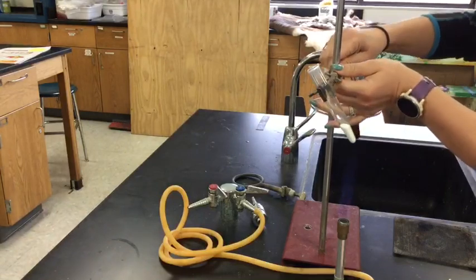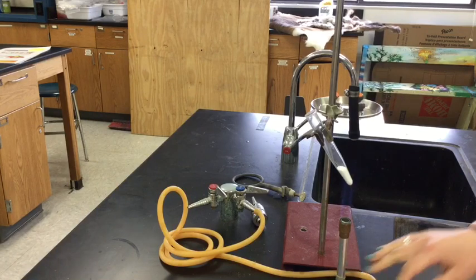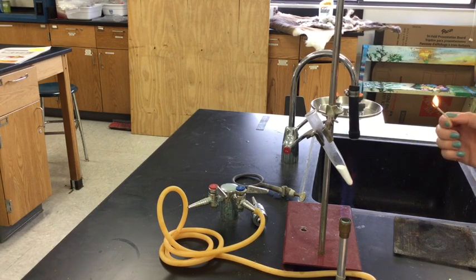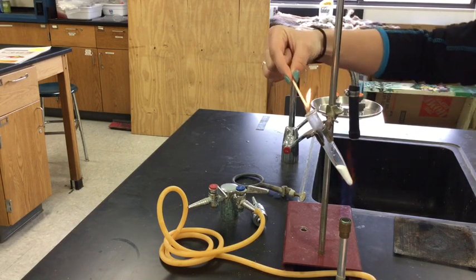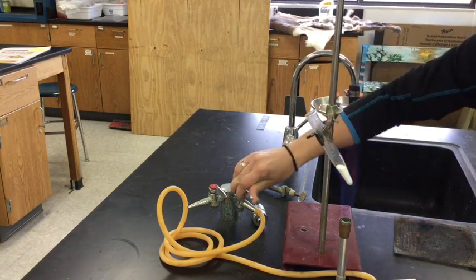We are going to start to heat this — notice I am pointing the test tube away from me. We're going to let it sit and heat, and then we need to test a burning splint on it. Oxygen gas will make the splint burn brighter, carbon dioxide gas will extinguish the flame, and hydrogen will make a yelping sound. I already see some condensation forming — and it put the match out. Turn off our heat.